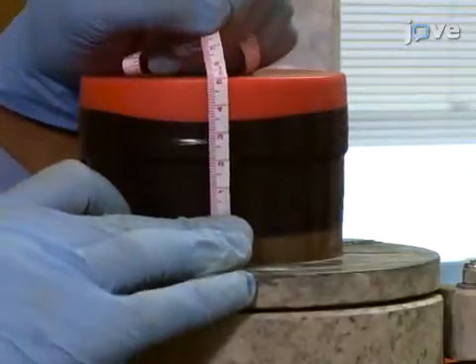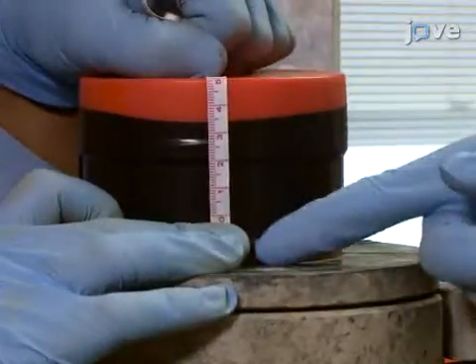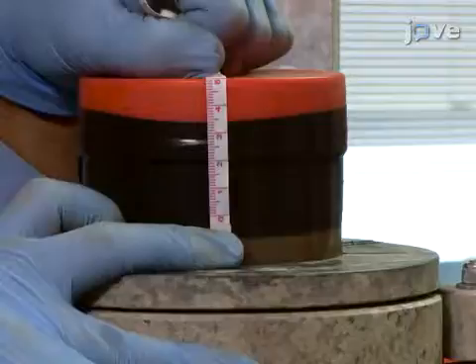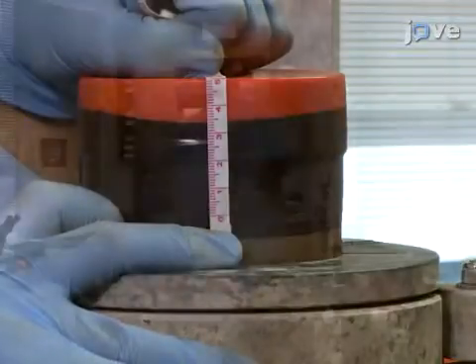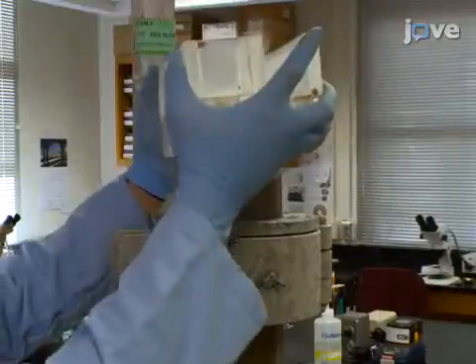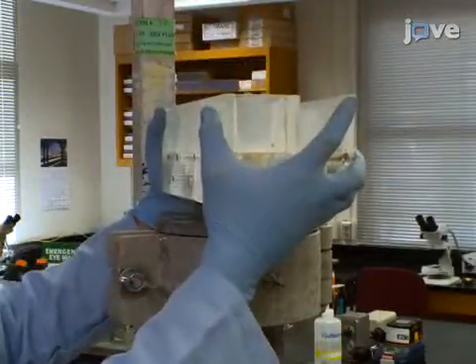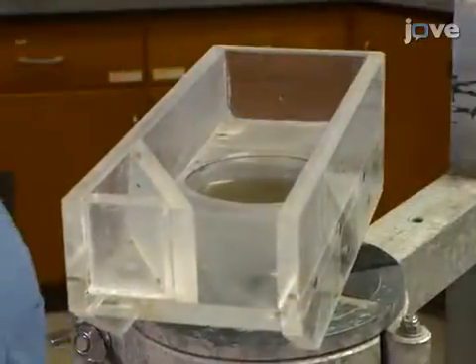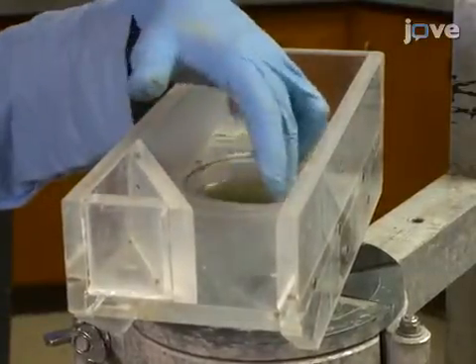Now ensure that there is at least 5 cm of core tube above the uppermost clamp to fit the sampling collar. Next, remove the top cap and place the sampling collar on top of the core tube. Make the collar flush with the uppermost extent of the tube or the sample may be lost.